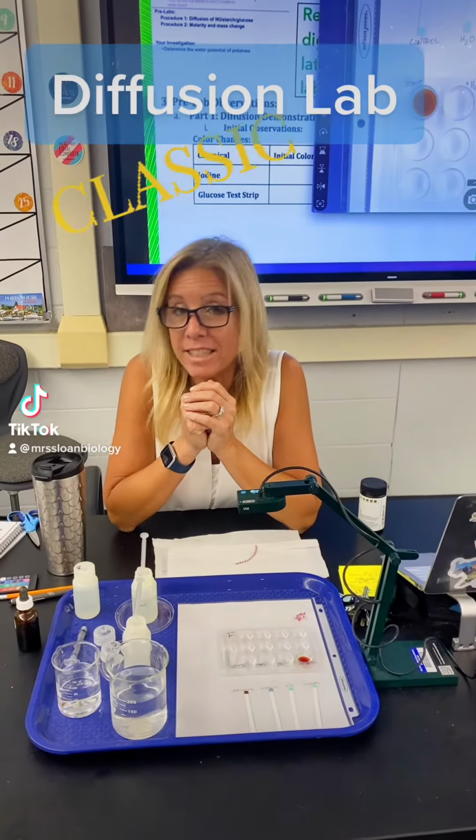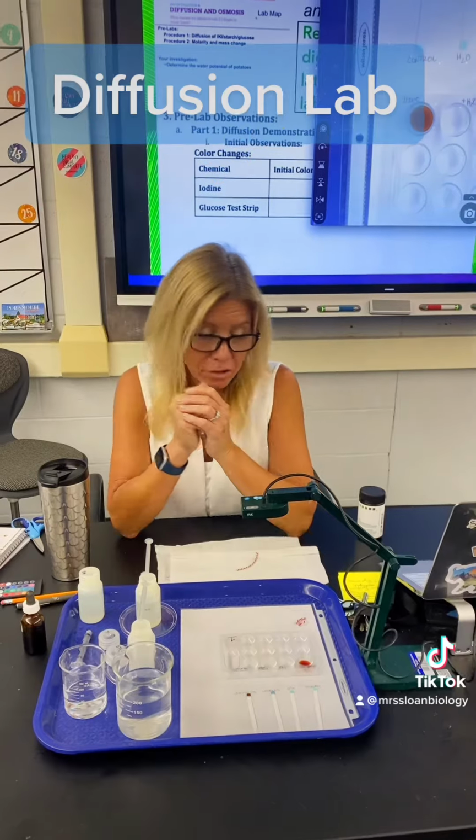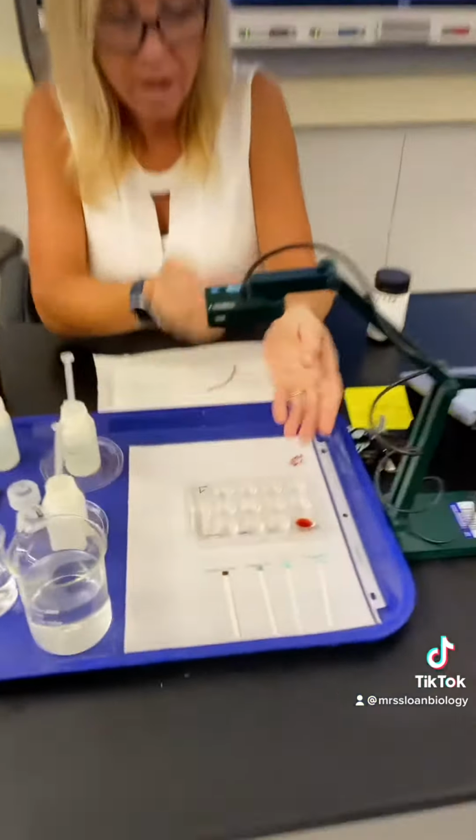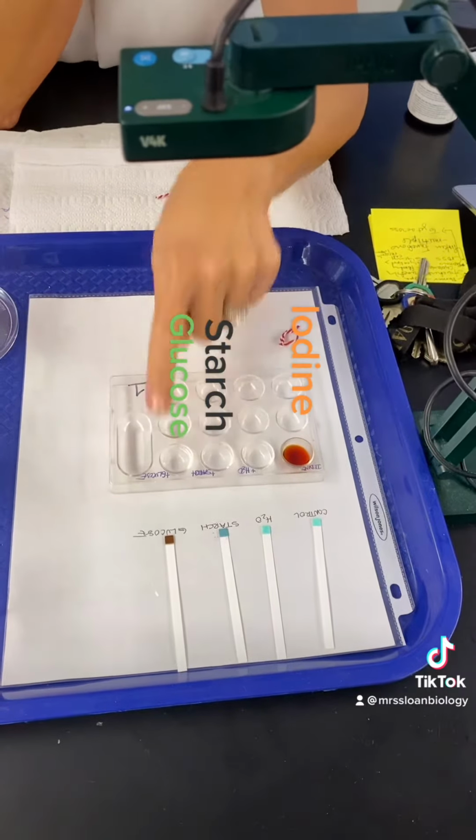Hi, this is a classic lab done in biology. So we're doing this on diffusion and then also osmosis. So take a look right here. So I have some iodine here. This is its normal color. There's water, starch, and glucose.